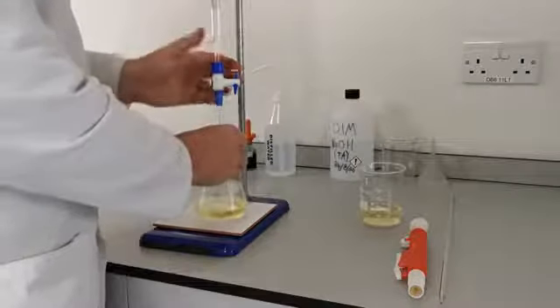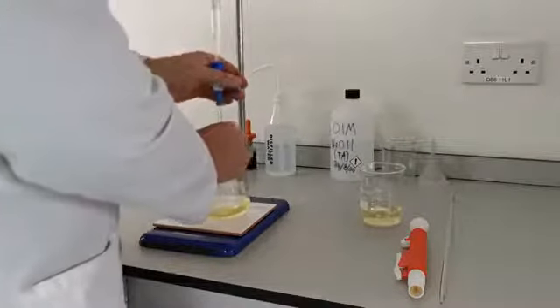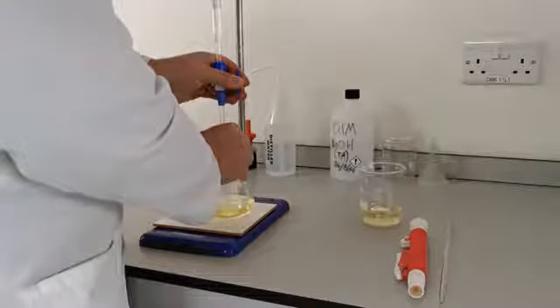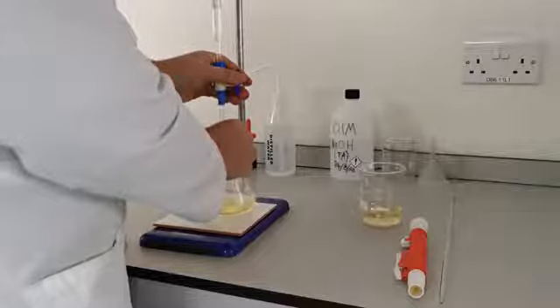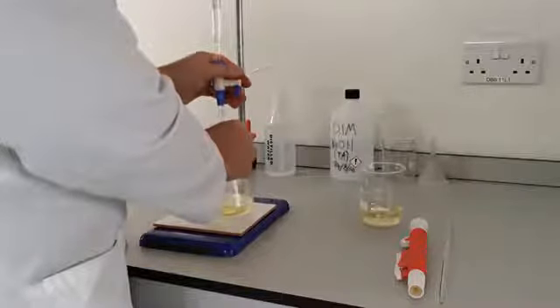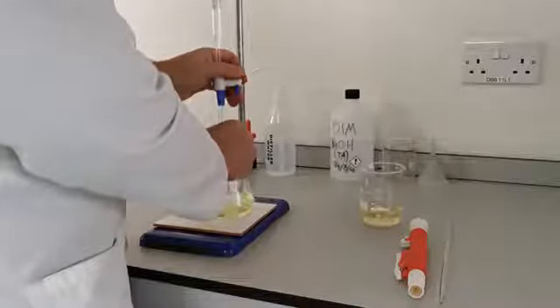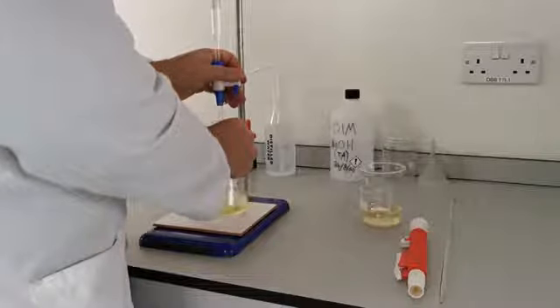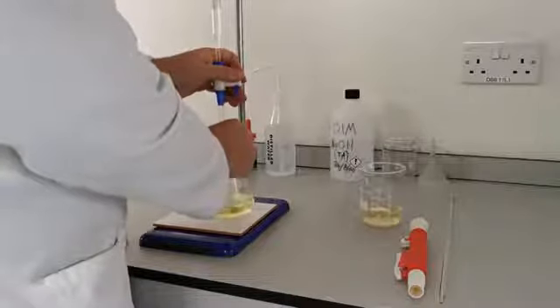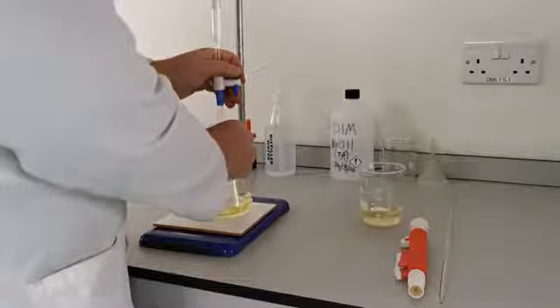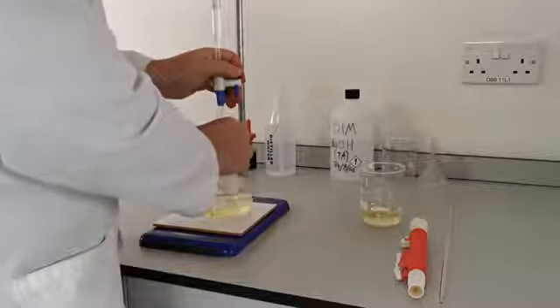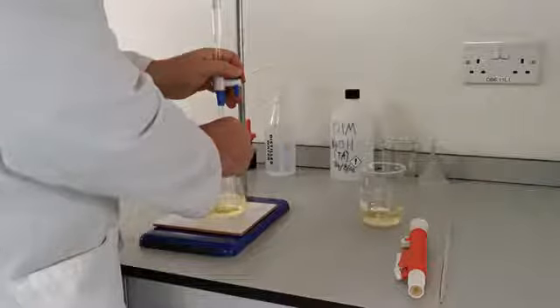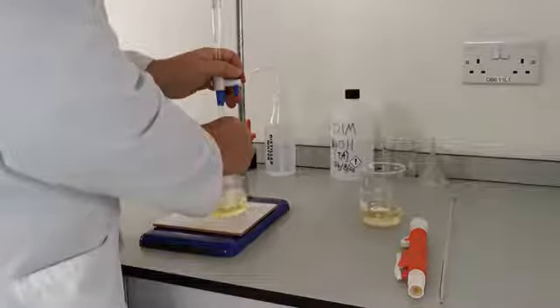We're now ready to start the titration, so place the conical flask under the burette and open the stopcock. Control the addition of sodium hydroxide with your left hand, while swirling the container with your right hand. It's extremely important to continuously mix the solution as you add the sodium hydroxide. On your first run, it's unlikely that you'll know exactly how much sodium hydroxide to add to your sample to neutralise it. So therefore it's important to go slowly, as you don't want to overshoot.